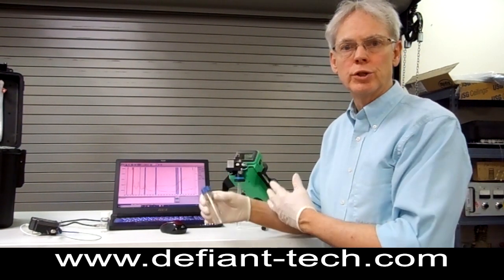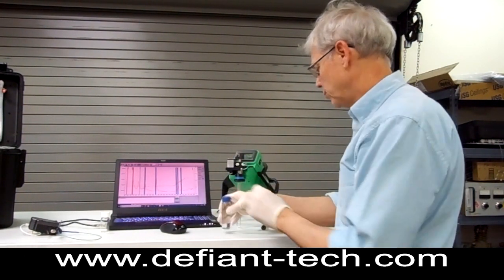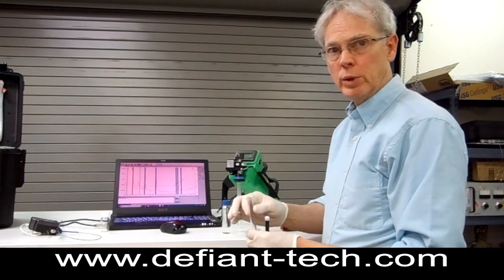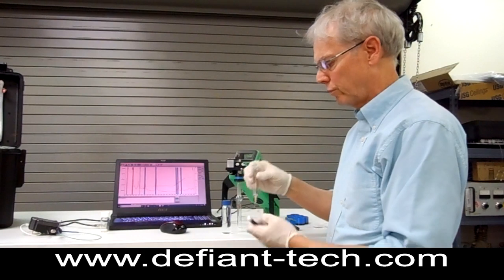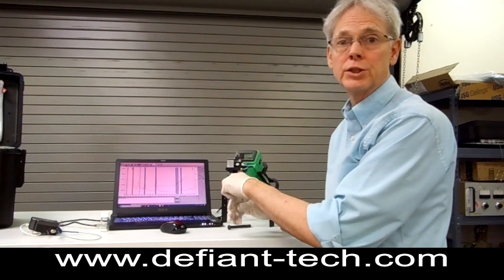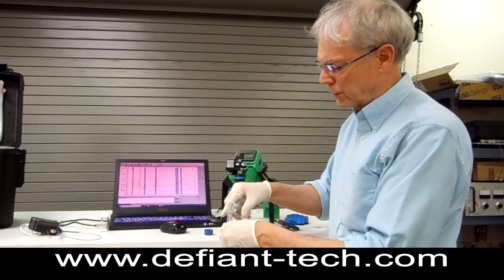With this sort of system, you can take and run those samples in the field and get your results right away. So the first thing to do is we will load a sample into the sparge bottle right here. It's a five milliliter syringe — this is a standard volume used in water testing. If you're sending a sample to an off-site lab, this is basically the same procedure they're going to be using. So I'll take my water sample here and load it into the syringe.